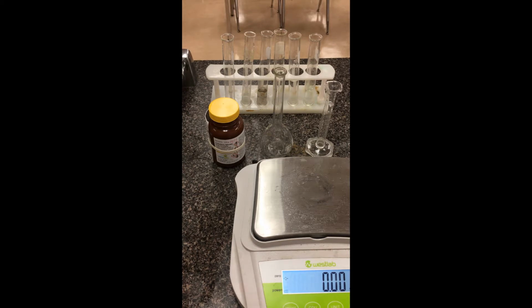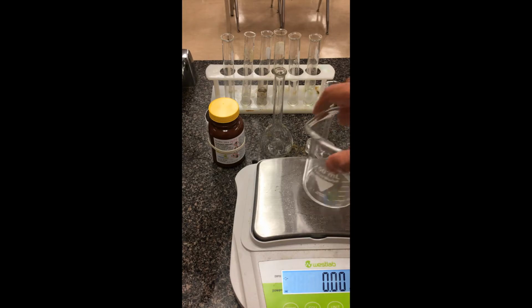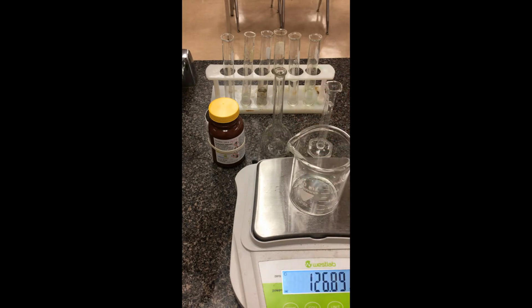So this is the first part. We're going to create our solution. So I have our cobalt-2 nitrate here. We're going to be making our solution in a beaker. Make sure your electronic balance starts off at 0. I'm going to put the empty beaker on top of it and tare the scale, so make sure it's 0 to begin with. Sometimes if the balance isn't level, it has trouble actually getting to 0. All right, but there we go.